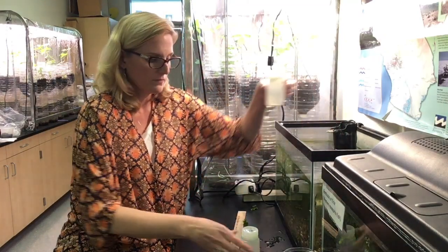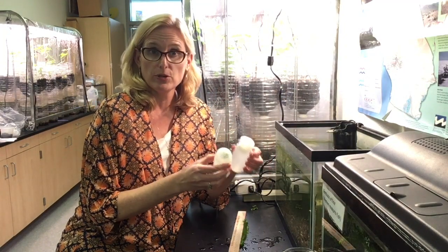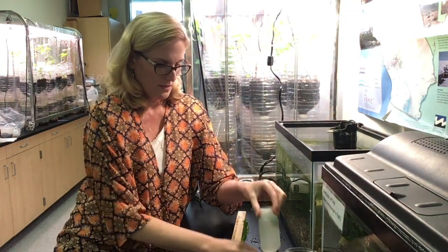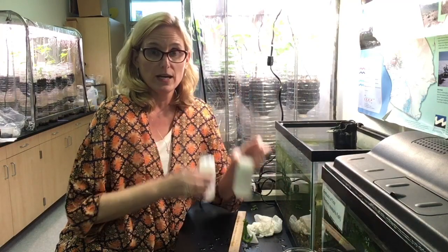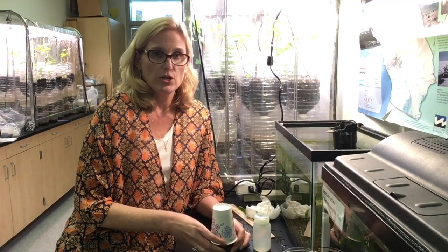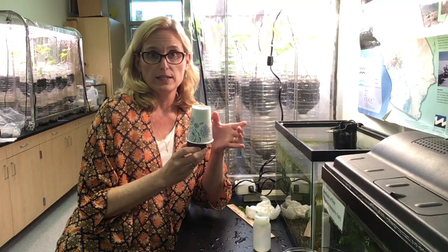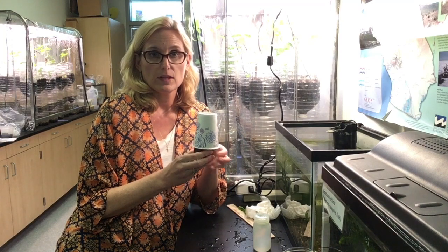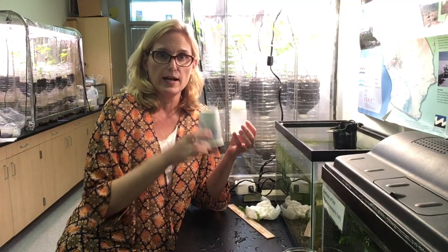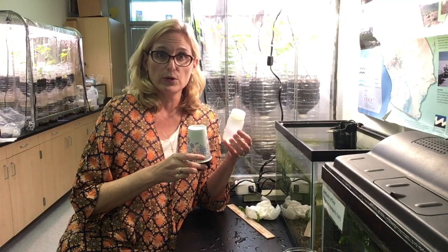I'm checking — no air bubbles, so these are good to go. I'm going to dry them off. Now I'm going to cover one with black paper and also put a cup over it so there's no light inside. What do you think this is going to measure with no light? It's going to measure cellular respiration. The other one is going to have both photosynthesis and cellular respiration because it will stay under lights. So I have one in the dark and one in the light, and I'm going to leave them for 48 hours.